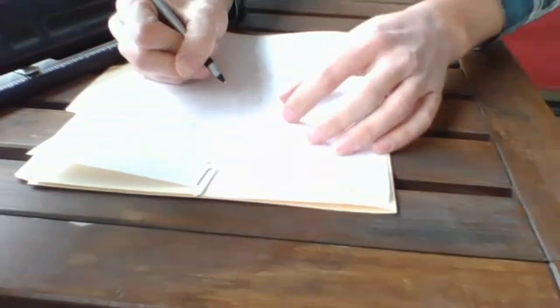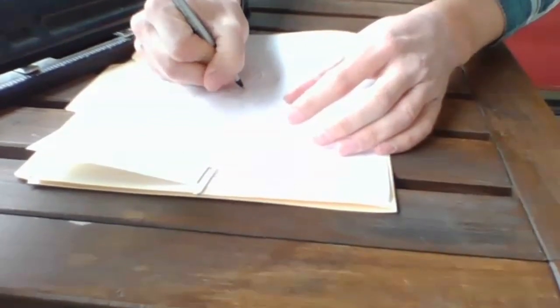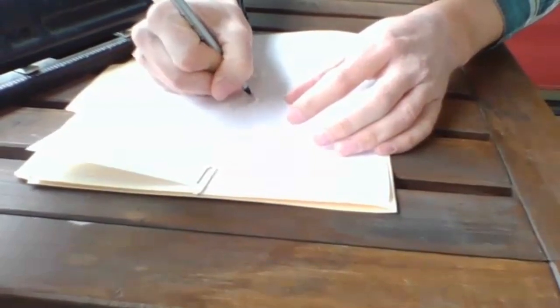All right, so what you're going to need to do then real quick, especially since we're using water and not simulated blood, is you're going to want to go through and just put little dots using some sort of pen or writing utensil around 4 edges of each of your droplets. Because what's going to happen, since this is water and not simulated blood, is the paper is going to absorb the water and it's going to spread out further. So those marks that you just made are going to be really important, especially if it's going to take you a little bit of time to measure them out.